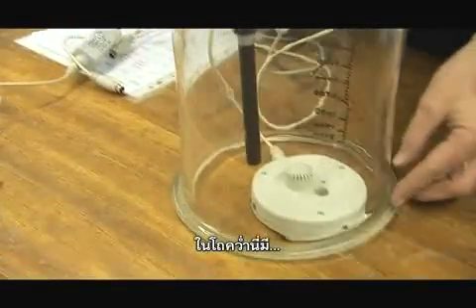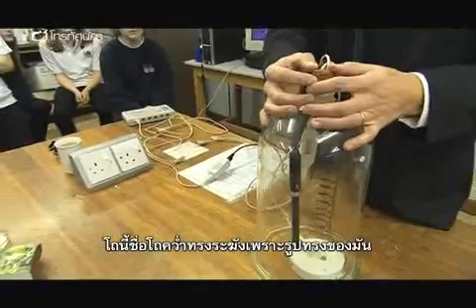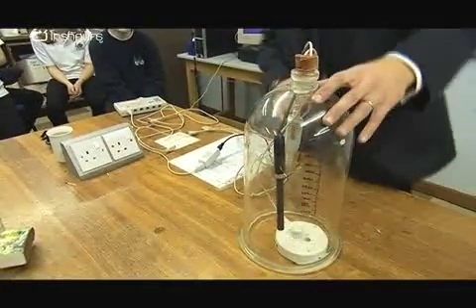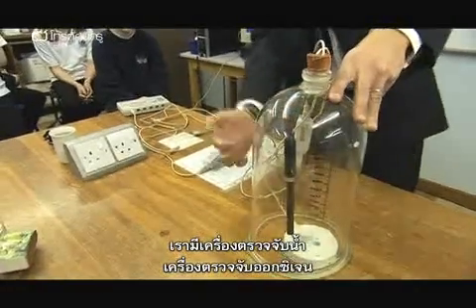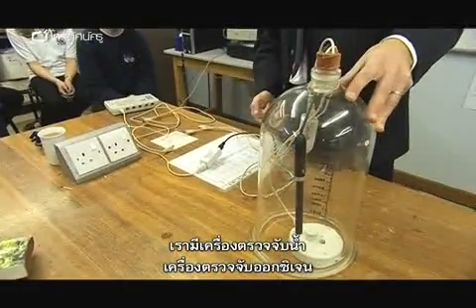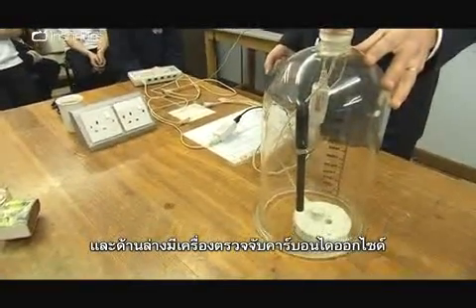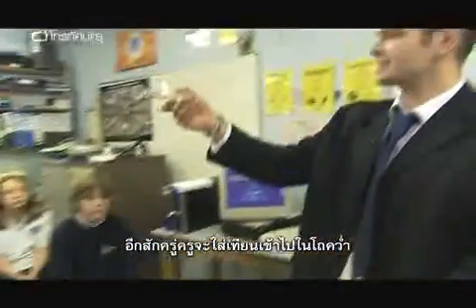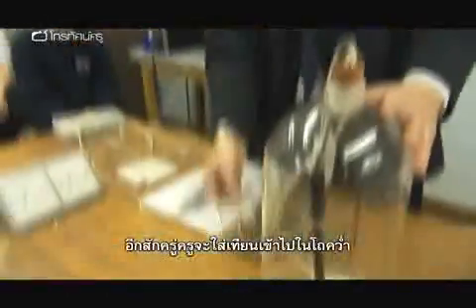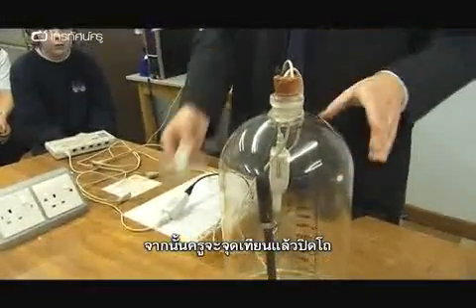What we've got here, inside this jar, is called a bell jar. It's called a bell jar because of the shape. We have in there a thing that detects water, a sensor which detects oxygen, and a sensor at the bottom which detects carbon dioxide. In a minute, I'm going to place this candle inside the bell jar, light it, and then close it off.